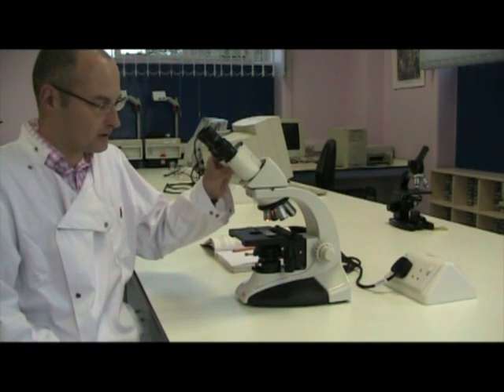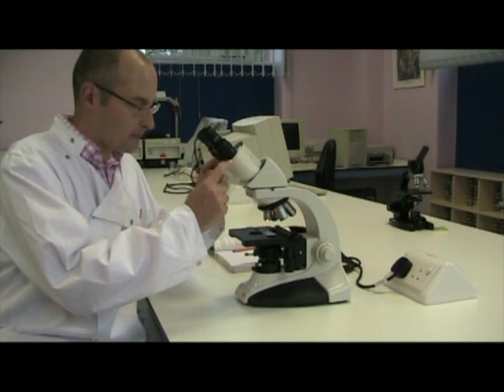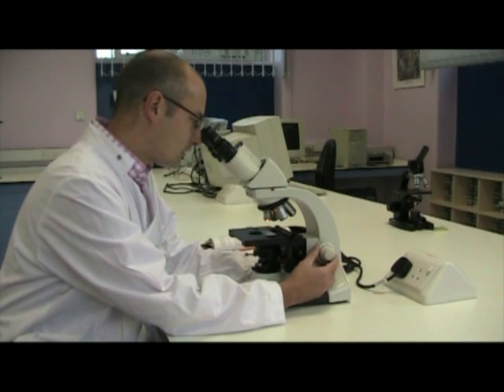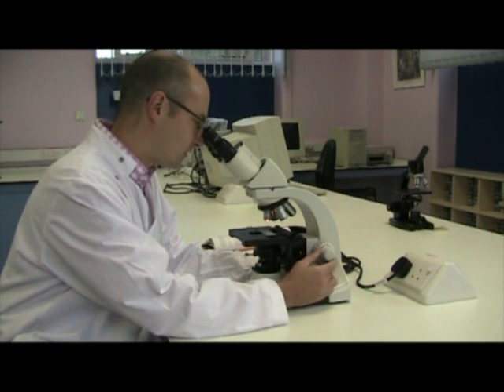Next, we need to ensure that the eyepieces are correctly focused. So look down the microscope — look down both of the binocular pieces at the same time. You need to hold the focus button, which is at the back of the microscope. Focus carefully on the specimen. First of all, you need to focus looking down the right hand eyepiece. So close your left eye and focus the specimen only looking down the right hand eyepiece.